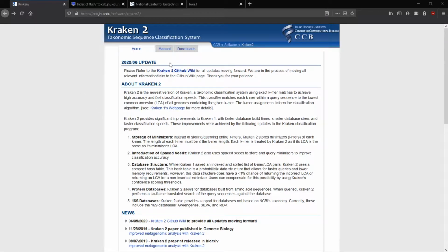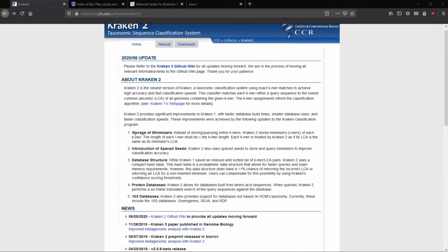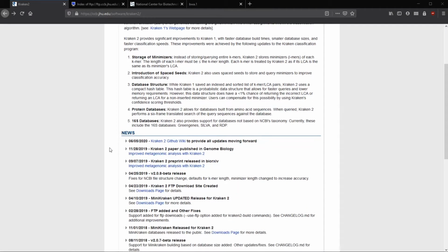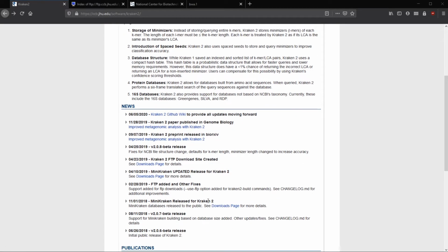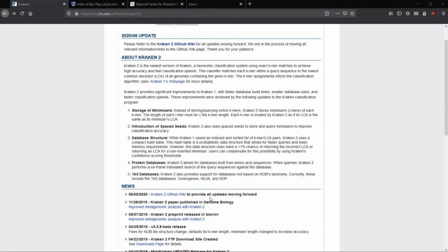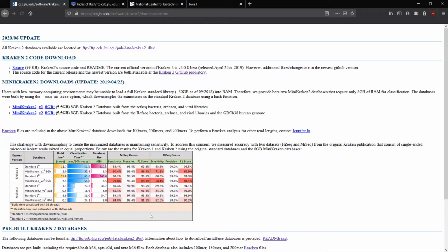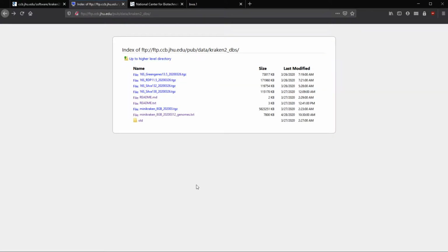So here on the screen is the Kraken 2 that I had mentioned. There's some release notes and everything here, but the main thing here is we want to download the database for Kraken 2. And to do that, we can go to the FTP page. See if I can find it here. Or maybe you can just go to the downloads page. And then FTP is here on top. So when we click on this link, it'll bring us here.